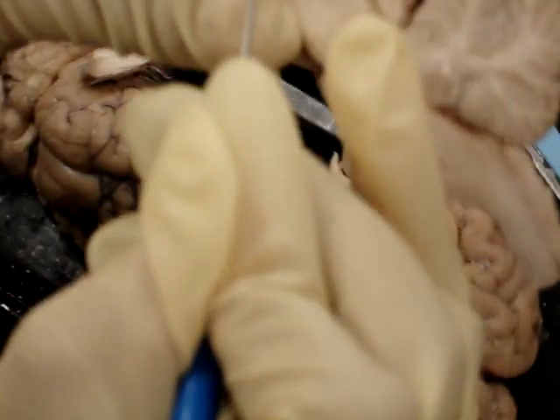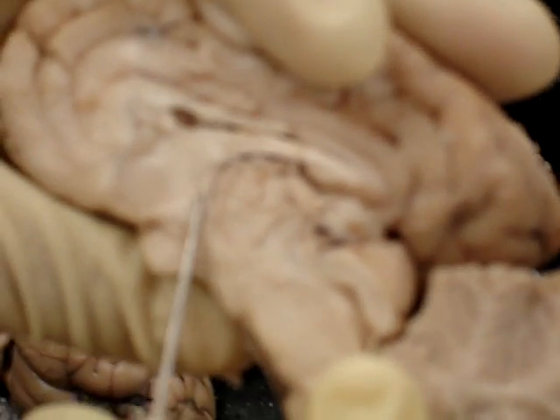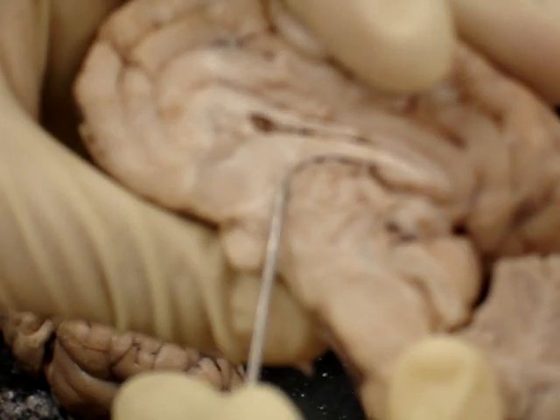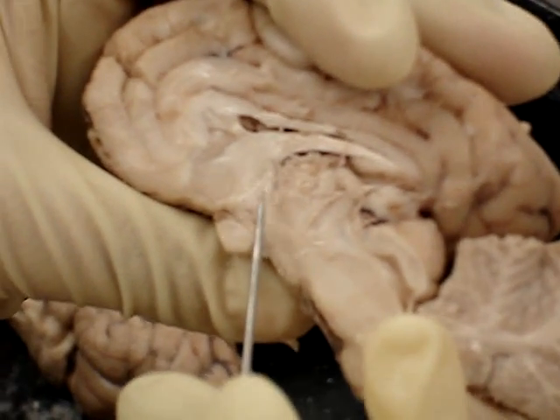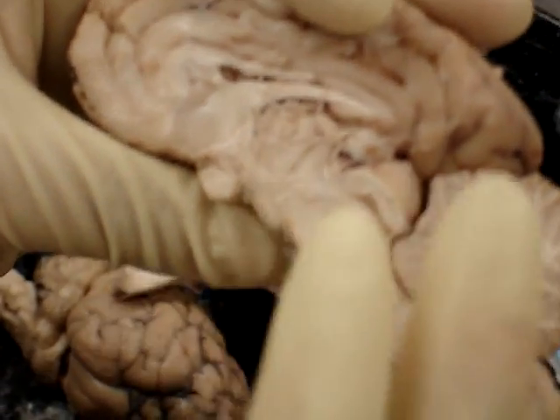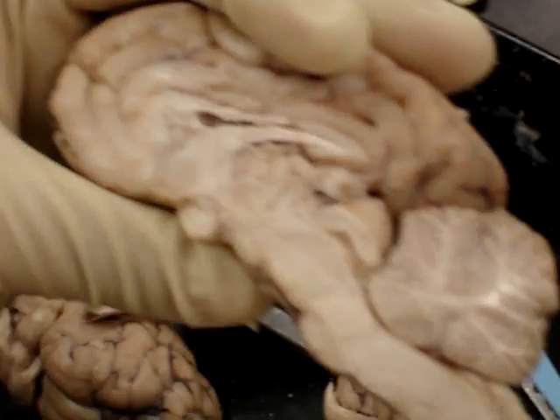The anterior commissure is in front, or anterior to, the masa intermedia — so it's this area. If you look at the other brains, it's slightly whiter than the surrounding tissue.